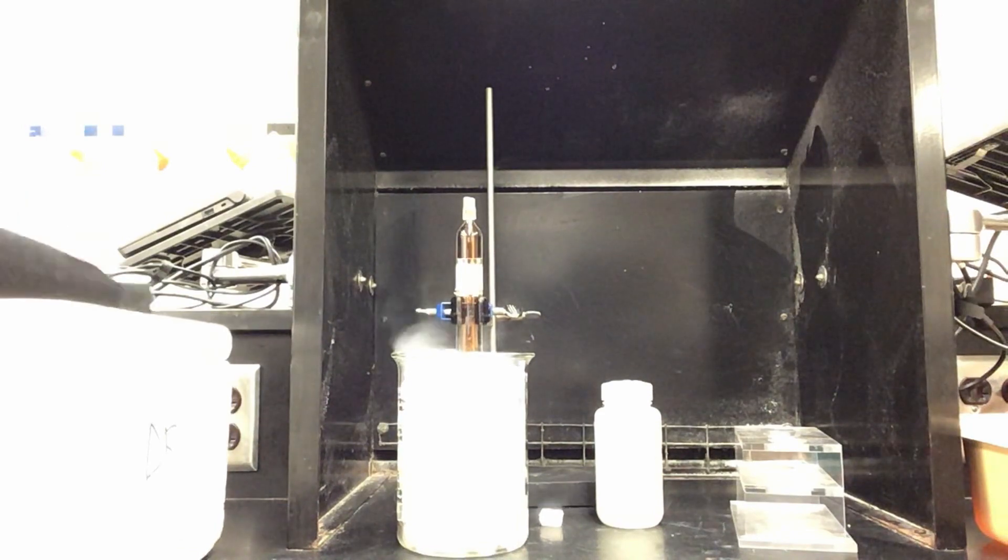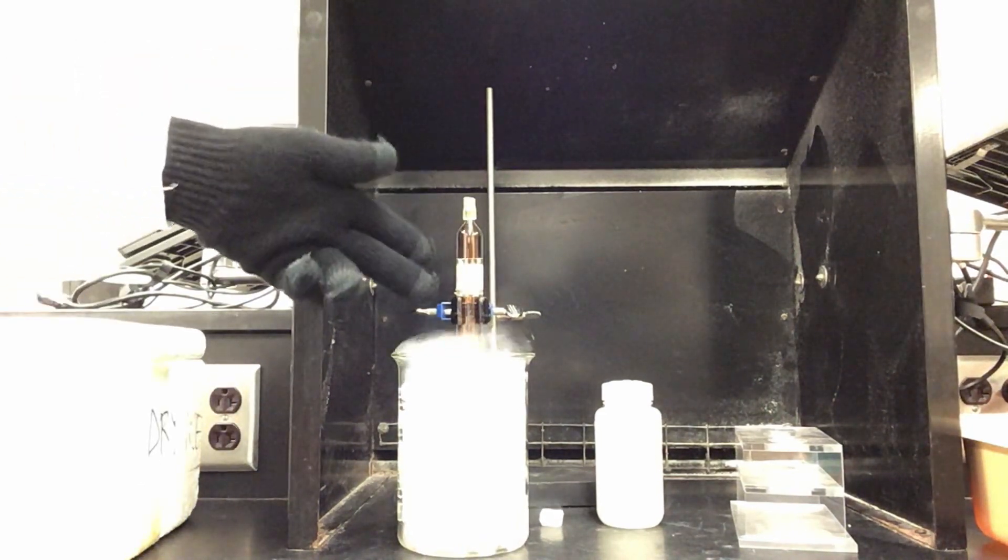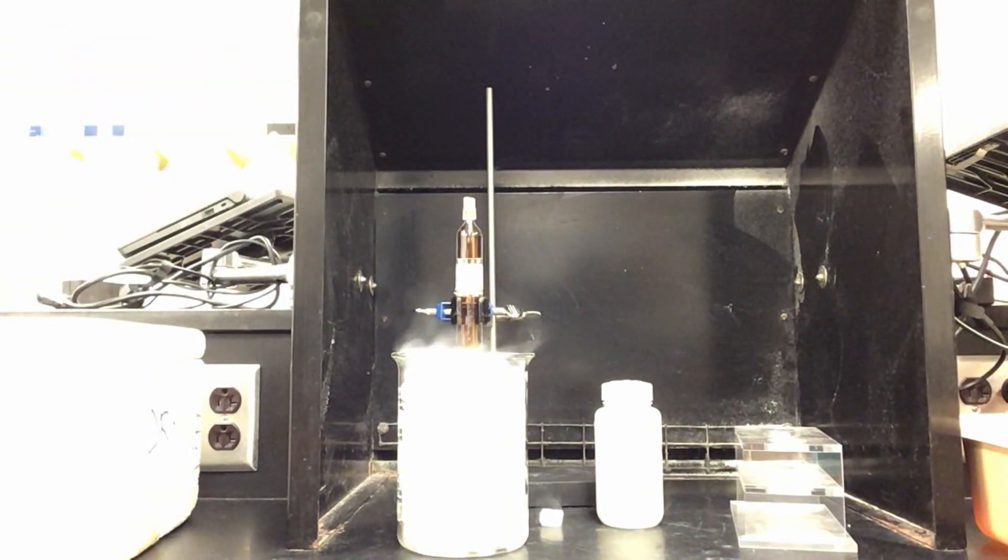As you can see, the starting color we have is orange within the tube, and now you can see how it will change once it is pulled down.